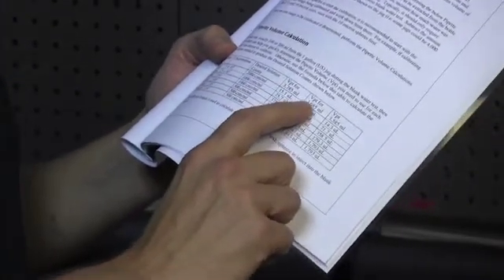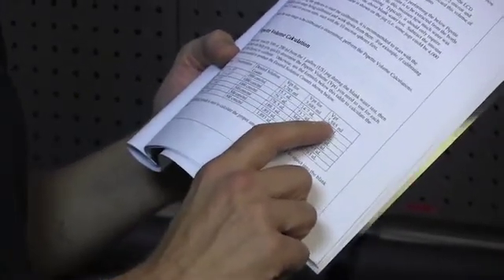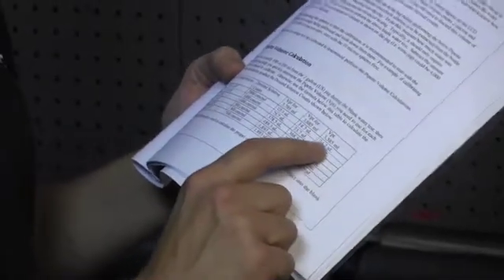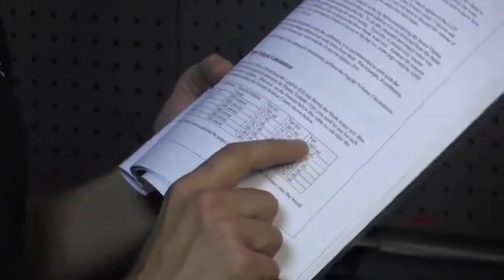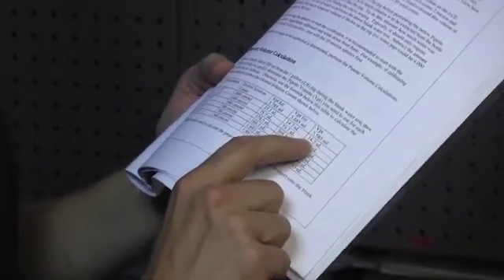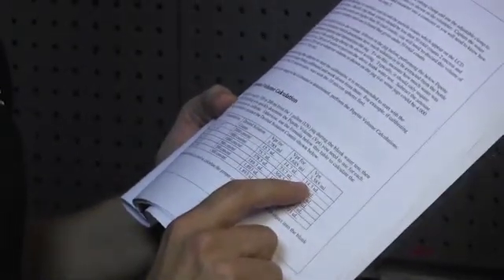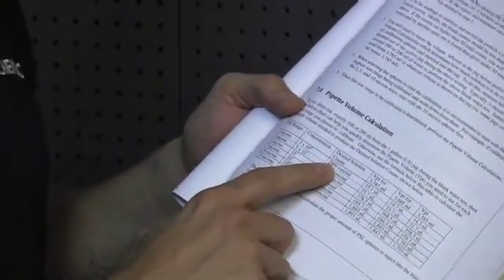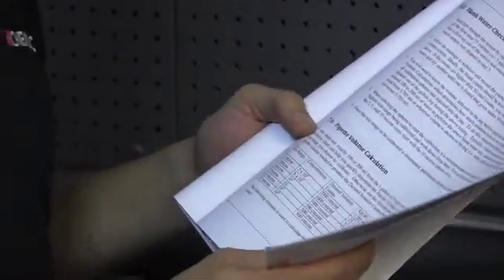And how much we need to pipette in if we took out 100 mils or if we took out 200 mils. In our case, we used 200 mils. So we have approximately 3,585 milliliters left. And for that volume, we need to add 14.3 microliters of the 2 micron spheres in order to get our counts up around 2,000 counts per milliliter, which is where we want to have them when we're doing the 2 micron calibration.